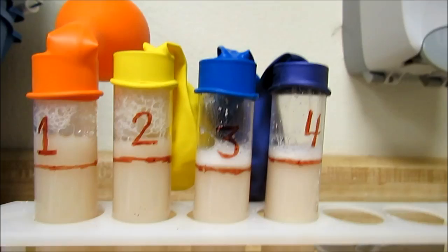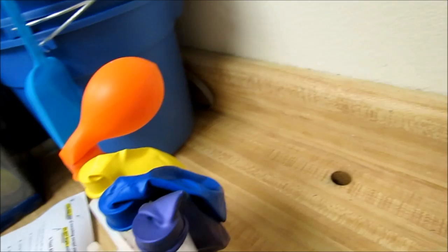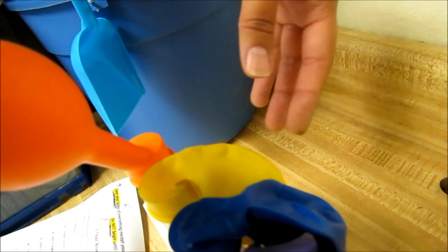Okay, so we are at the 20-minute mark now. We should be taking our observations for the 20-minute mark. Kind of hard to see number two here.